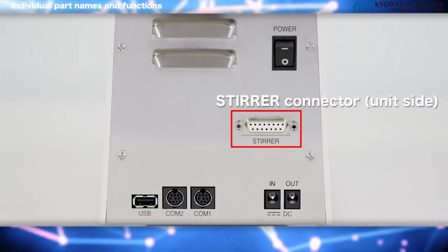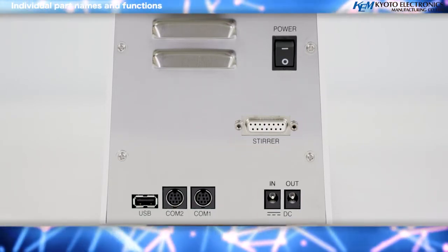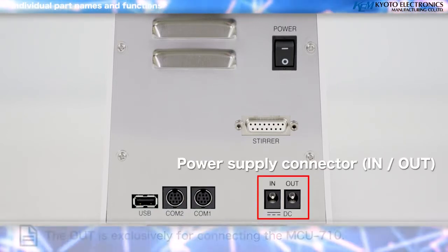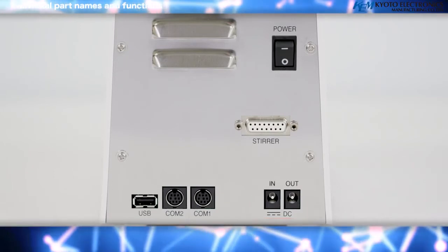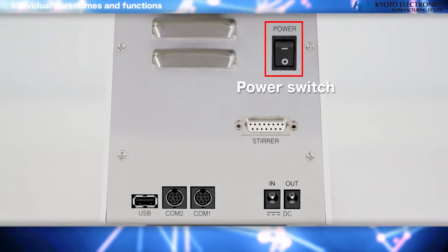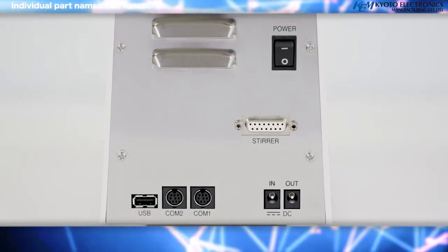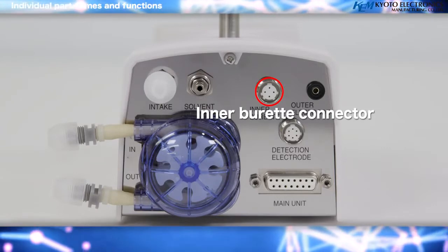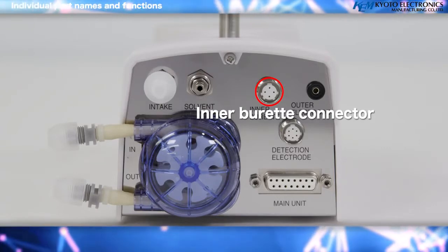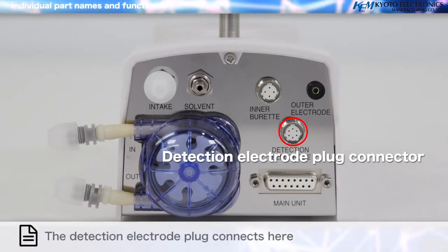Stirrer connector, unit side. The magnetic stirrer that stirs the sample solution connects here. Power supply connector, in, out. The power cord connects here. Power switch. This switch turns the power supply of the device on and off. Inner burette connector. The inner burette plug connects here. The detection electrode plug connects here.